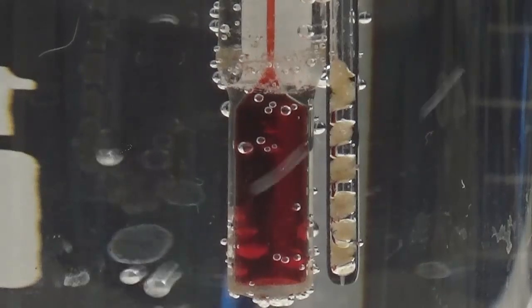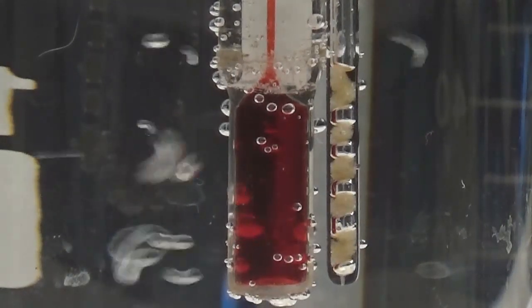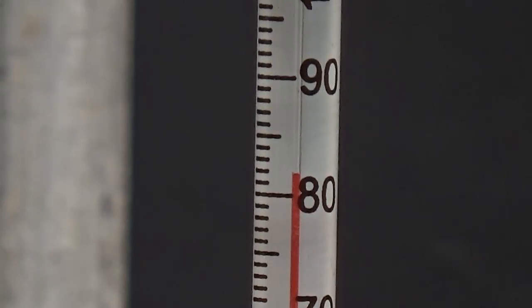The theoretical melting point is 78 to 80 degrees and in this test it was 78 to 82 degrees. The yield of this synthesis was 42 percent.